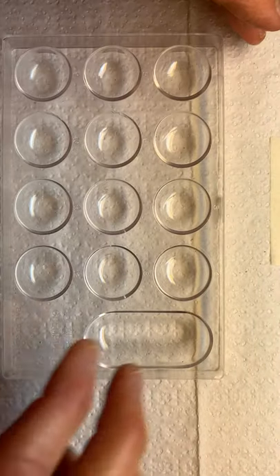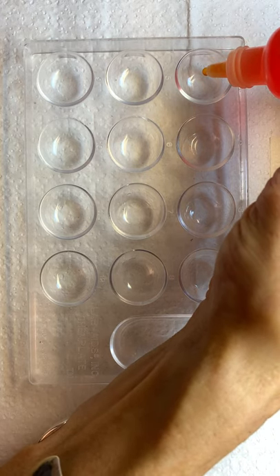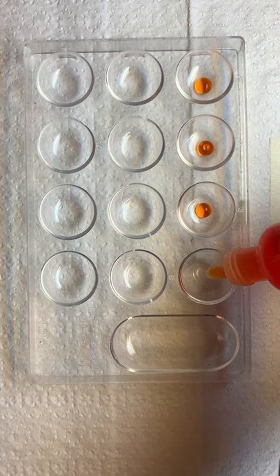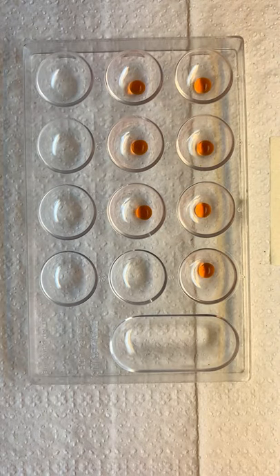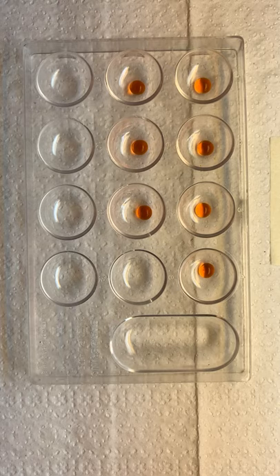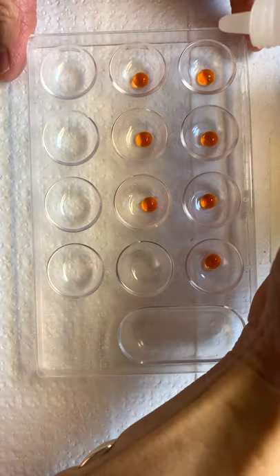Let's start with methyl orange. We're going to test each one of these pHs — those odd number pHs. We're going to take one drop of methyl orange in wells one through seven, because we have seven bottles of pH to test. We've got one drop of methyl orange in each one, and now we're going to add each of the pHs — one drop of pH one to the first well.